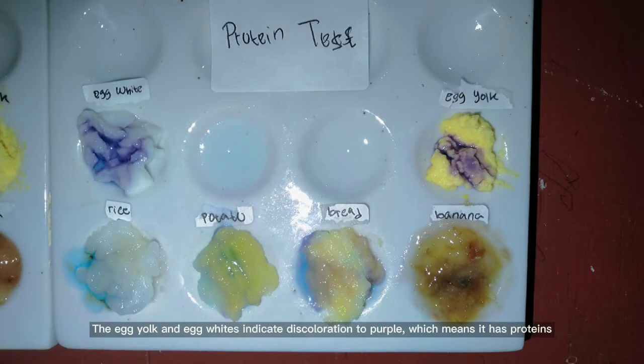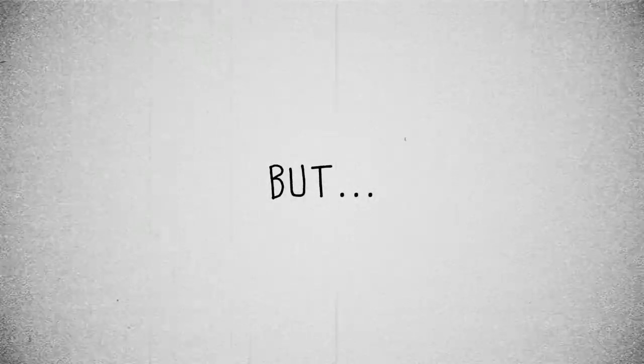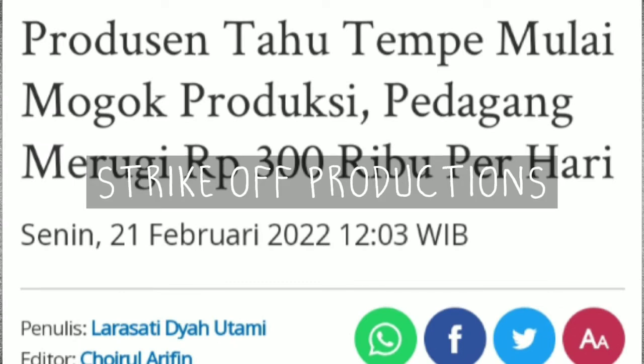The egg yolk and egg whites indicate discoloration to purple, which means they have proteins, while bananas, bread, potatoes, and rice indicate no discoloration, meaning no protein. Previously, I wanted to use tempeh and tofu as a high protein sample, but the rising price of soybeans made the craftsmen strike off production.